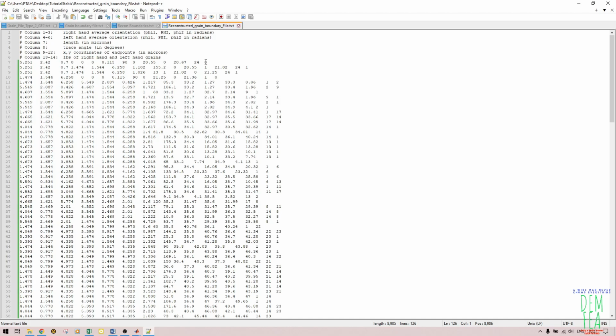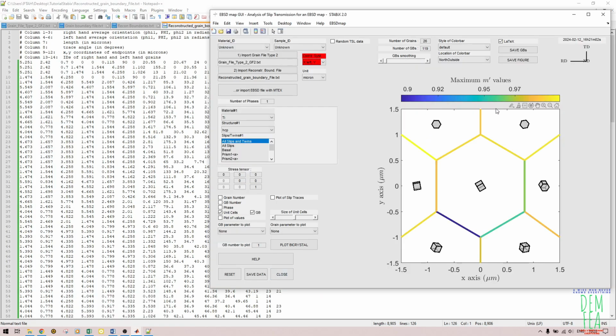As you can see here, this grain boundary is 0. This one, this ID is 0, and as you can see, you also have zeros here. So what you need to do is to eliminate all the rows with zeros at the end, because that grain is outside the boundary, it's outside this box, so it's not recognized by the code itself.